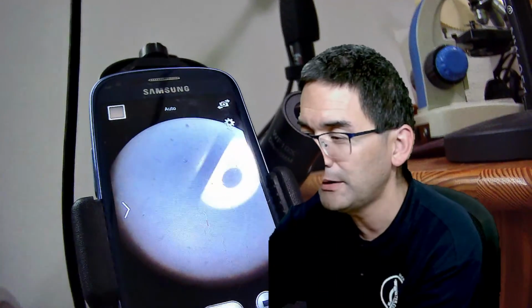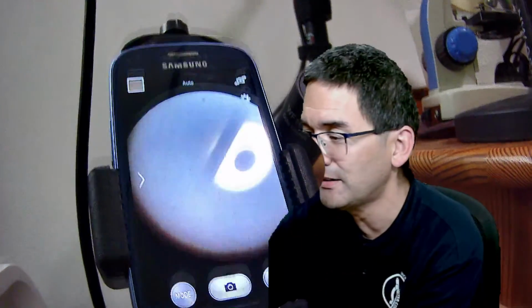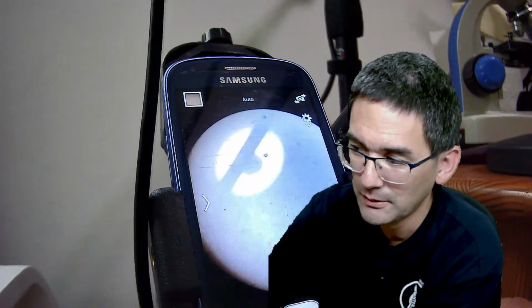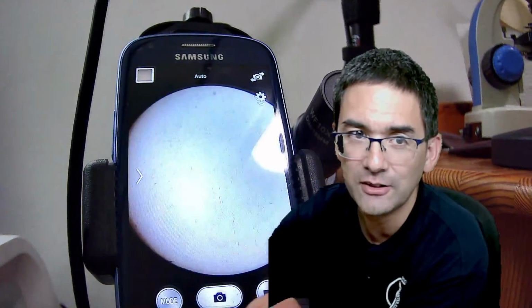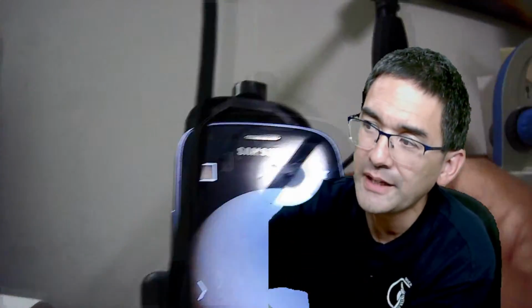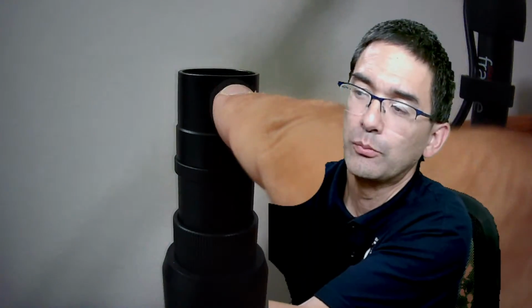And concerning stability, look at this. You see, it's very sensitive. If it's not very stable, then you immediately see that it's blurry down here. So this is kind of the disadvantage of mobile phones. But if you connect it maybe to the trinocular head, where can I find it? Okay, where is it here? Yeah, and the top, then of course it's going to be much more stable.